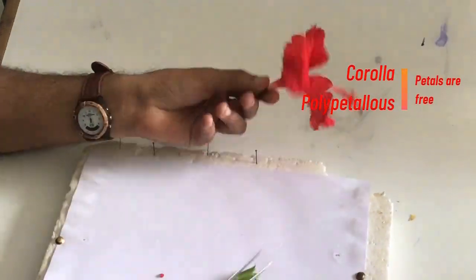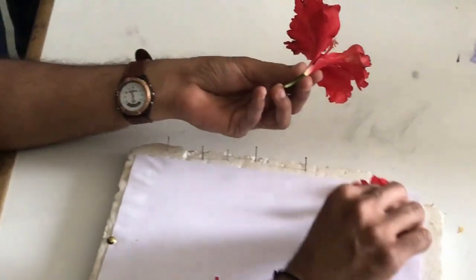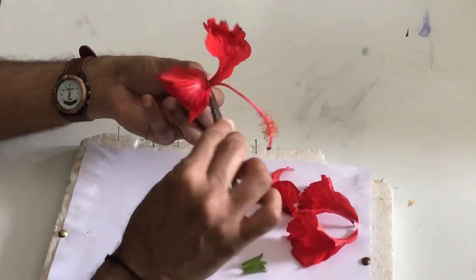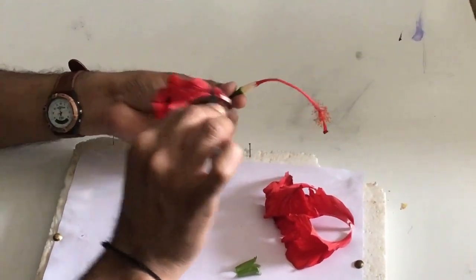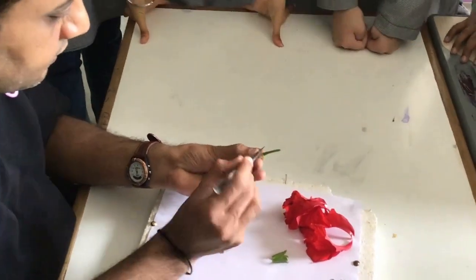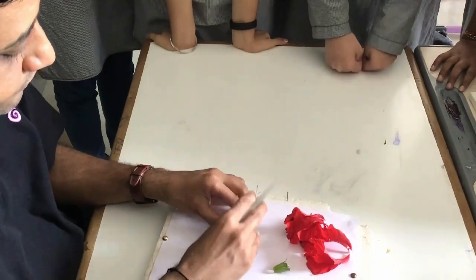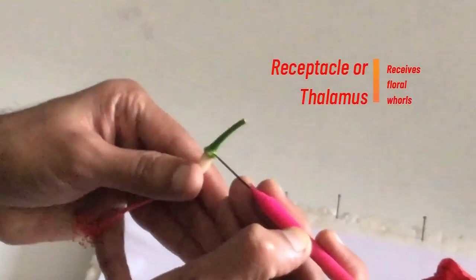Now first whorl, second whorl done. Now we go to the third whorl — this is the corolla. I will take one petal and take it off like this, then another one and so on. When I come to the last petal, be careful because here is where the ovary is hidden inside. Also, where the pedicel ends, this part that receives all the floral whorls is called the receptacle, also called the thalamus.